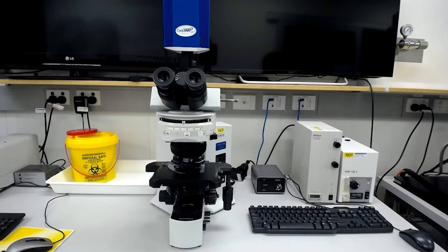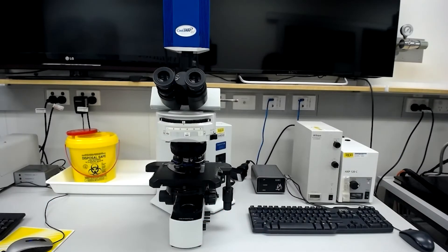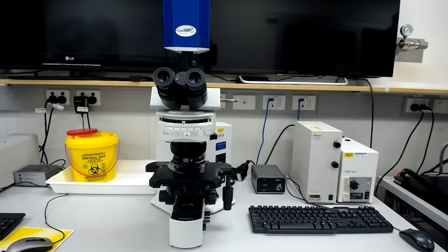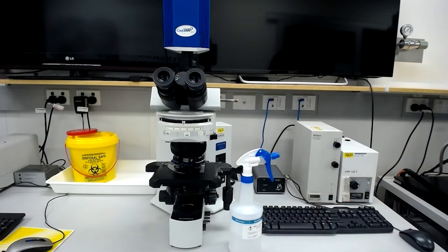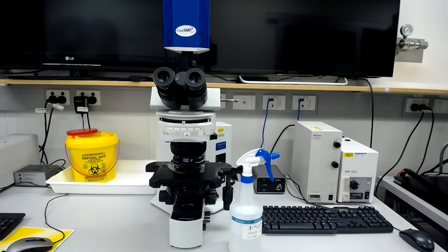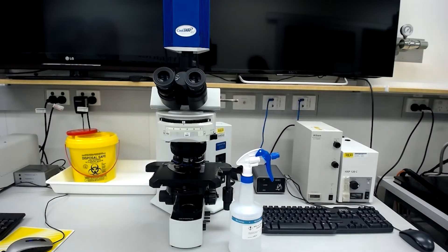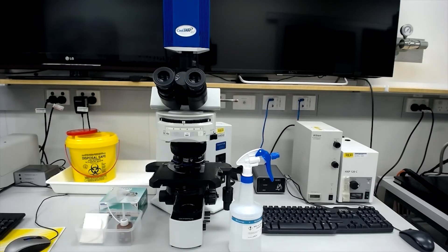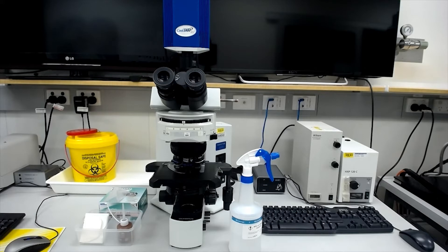Inspect the microscope and surrounds before you start imaging, and clean the area if necessary. A bottle of 80% ethanol is provided at every microscope for you to wipe down surfaces such as the tables and microscope stage. Cleaning supplies and immersion fluids are provided, so speak to staff if supplies are low.